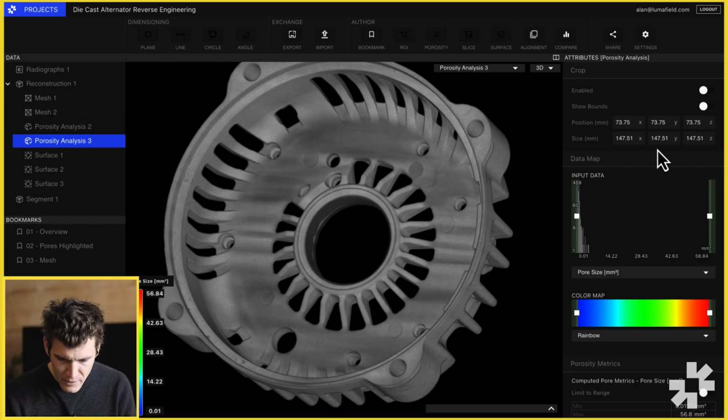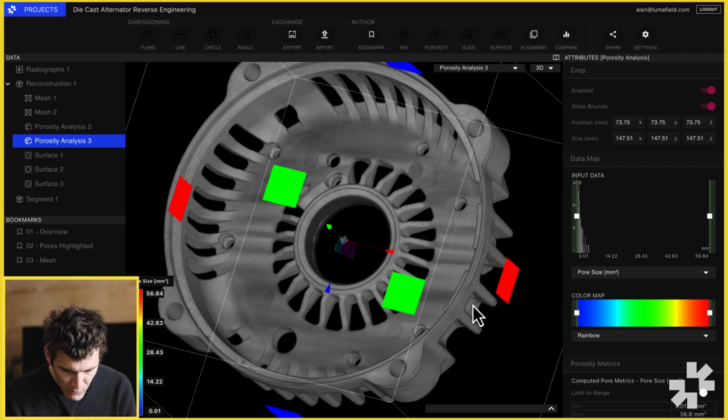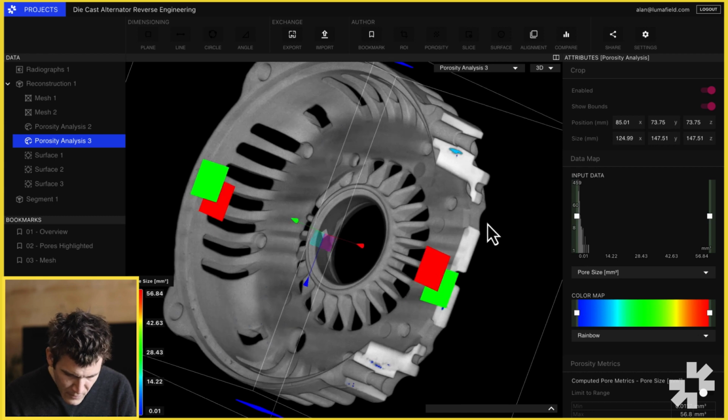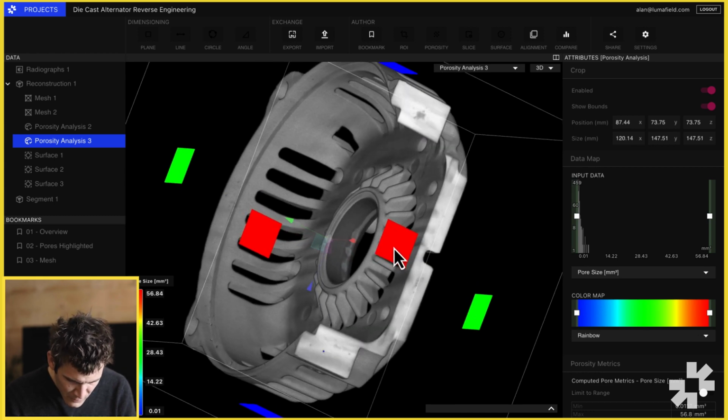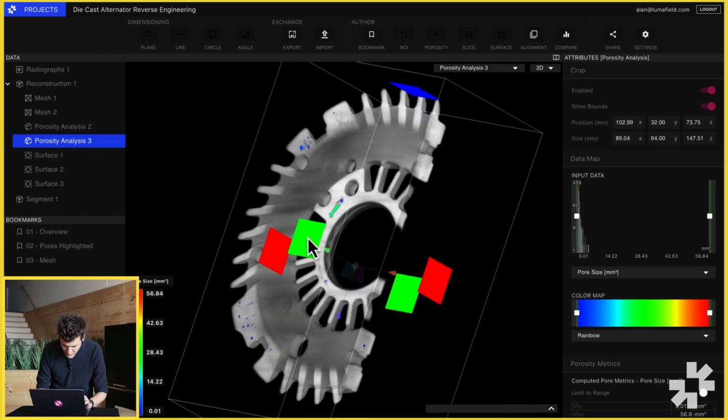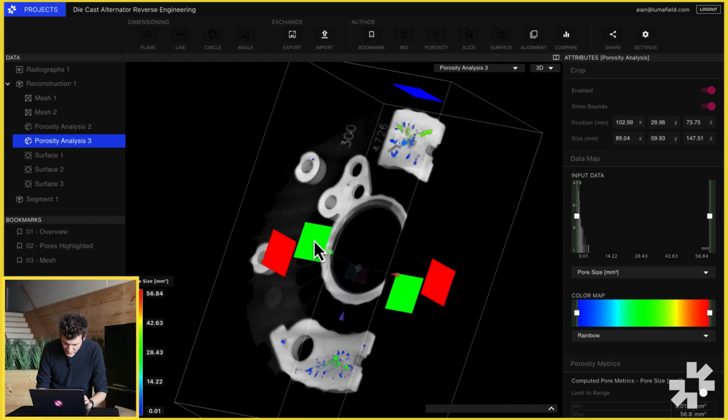By making the part solid again, we can now use our cropping tools and very easily see where the pores are in the part relative to the surface and see those pores in the bulk solid material. The cropping tool can be very useful to show the pores in the broader context of the 3D part. We can use these rendering settings to both make the part more solid and enable cropping to better see where the pores are in the bulk material, or we can actually use those rendering settings to just isolate the edges, making it easier to see where those pores are relative to those edges in the structure of the part.